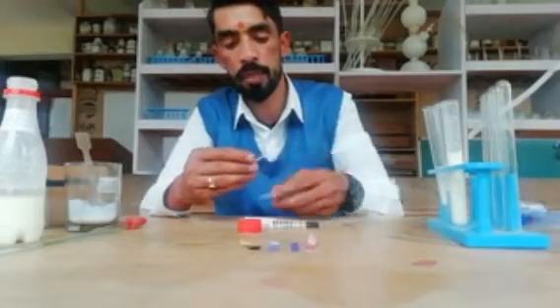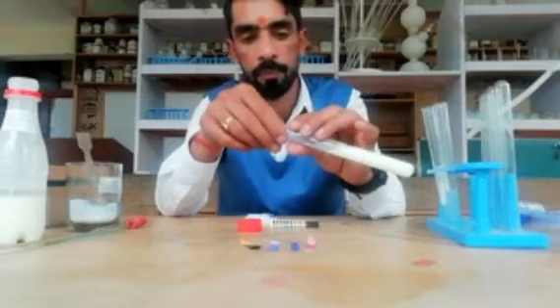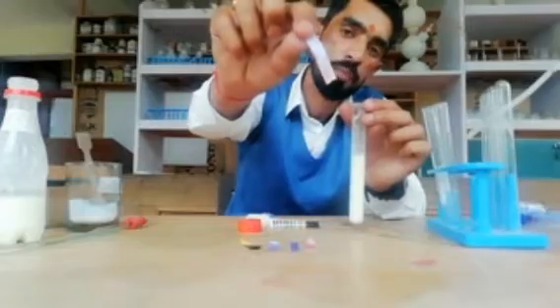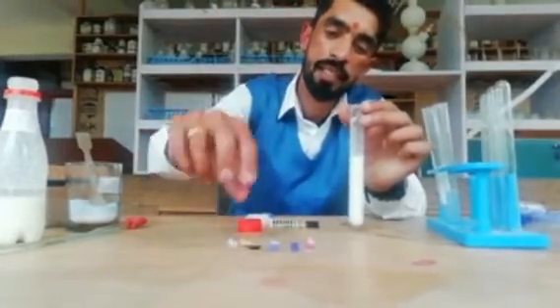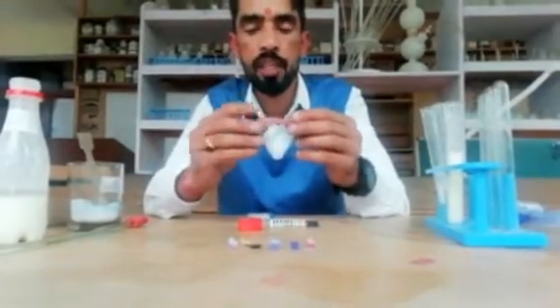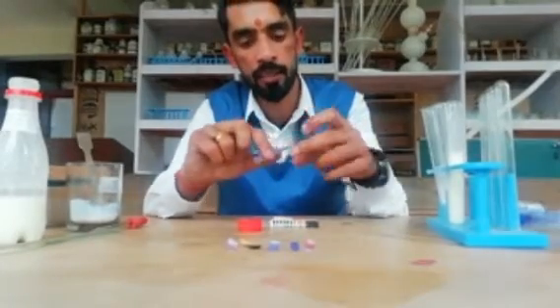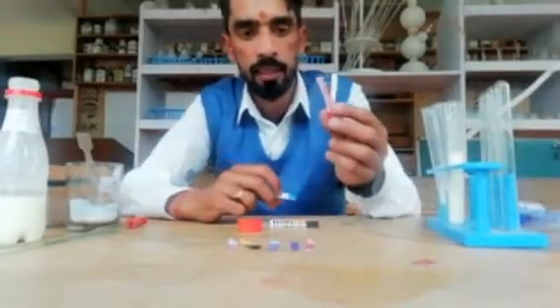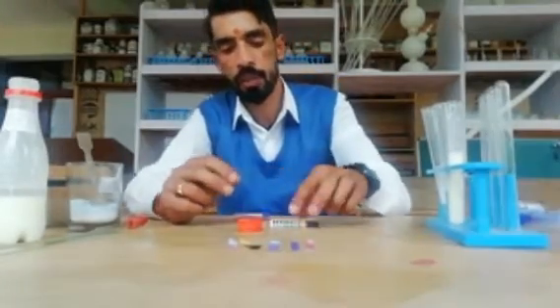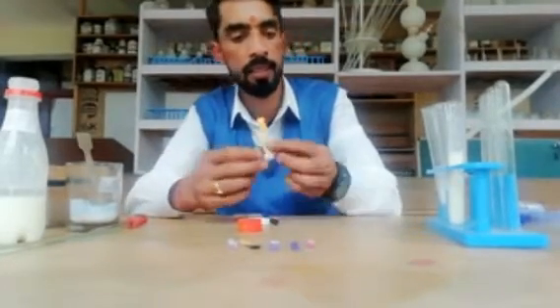Obviously, blue litmus is going to change into red when it comes in contact with acid. You can see the magic — blue changes into red in the case of acid. To summarize: in base, red litmus changes to blue; in acid, blue litmus changes to red. In acid, red litmus remains red, and in base, blue litmus remains blue.